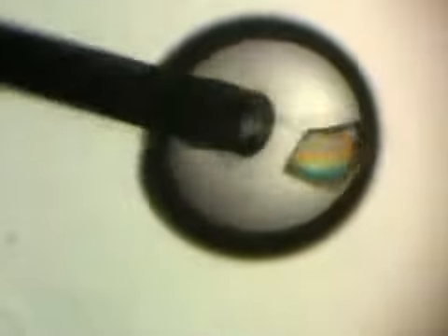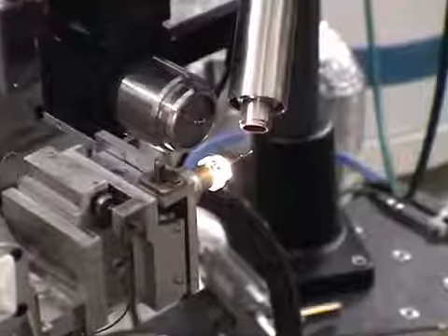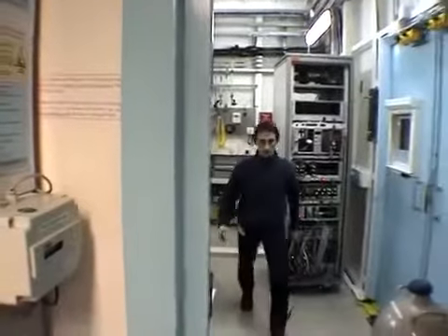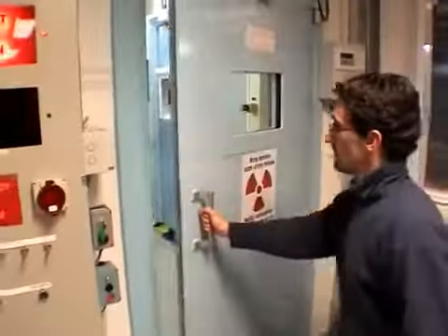The crystal is pinned under the microscope with the help of a lasso and is then frozen in a stream of gas at very low temperature to minimize the detrimental effects of the radiation. The crystal is positioned in the center of the X-ray beam with the help of a camera. Once the crystal is in the right place, the scientists leave the hutch and close the door. They follow a very strict safety procedure which prevents accidental radiations from occurring.